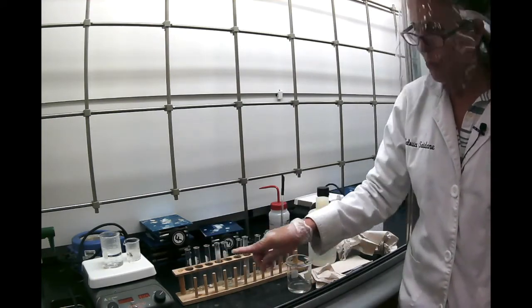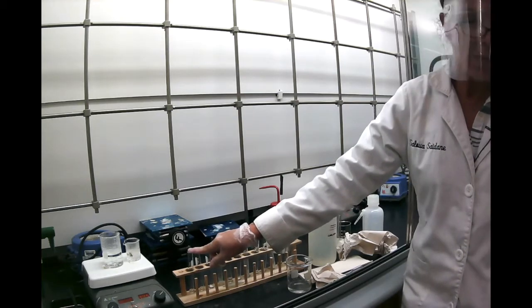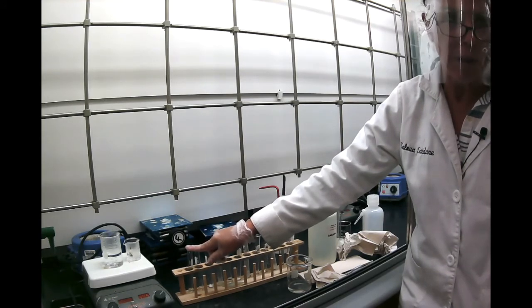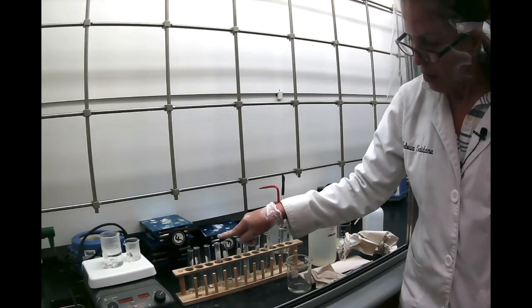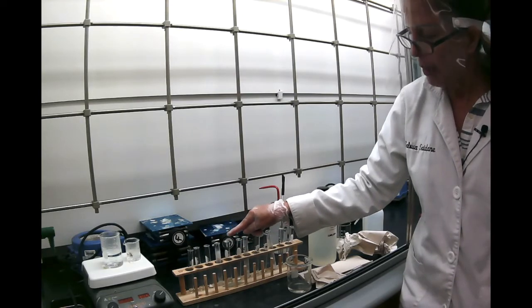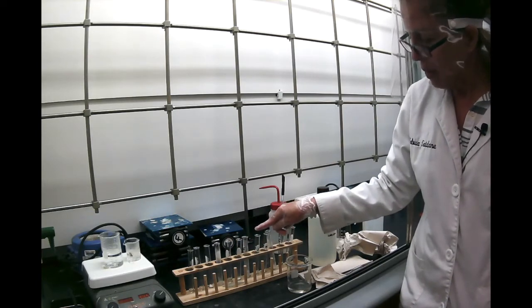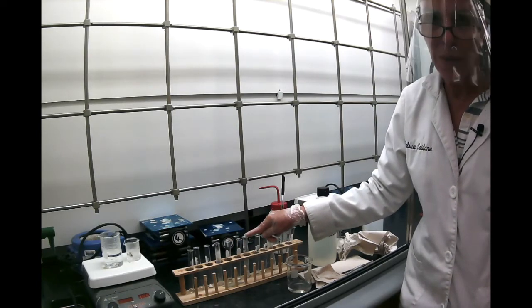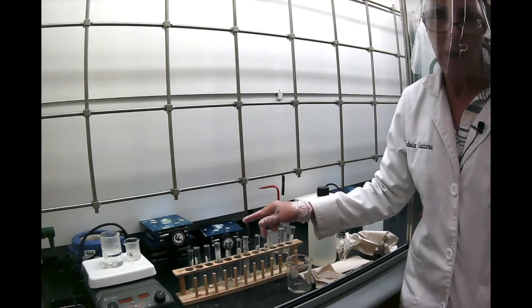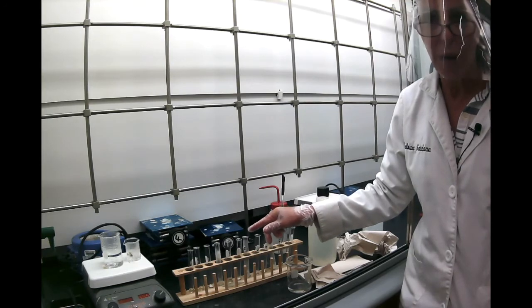Okay? So let's summarize what we've observed. If we look at resorcinol, it dissolves in cold water, so we don't even need to heat it, and it dissolves in ethanol. The next substance was naphthalene. Naphthalene is not very soluble in water, but it's more soluble in ethanol when it's hot. Then we go to benzoic acid. We saw that benzoic acid doesn't dissolve in cold water, but it's soluble in hot water, and it takes a good amount of hot water to dissolve it.